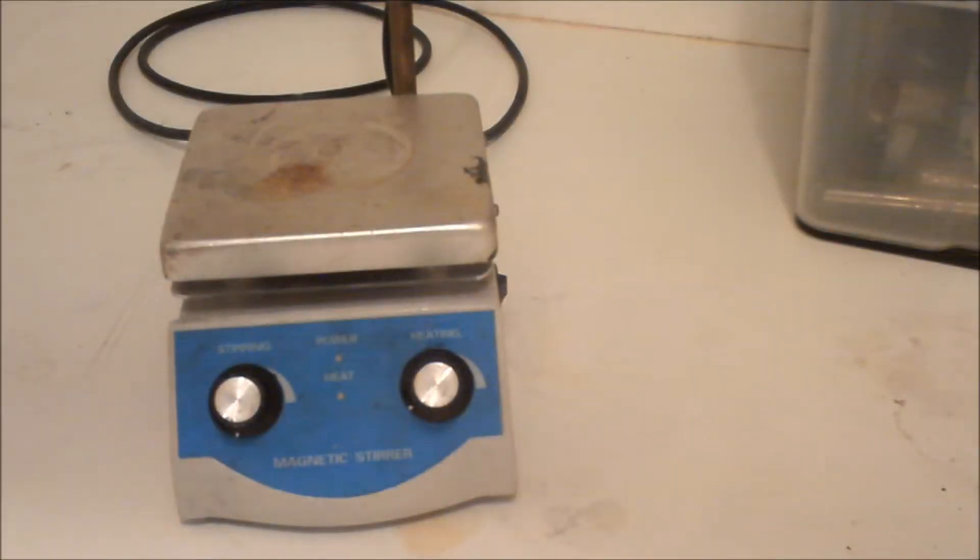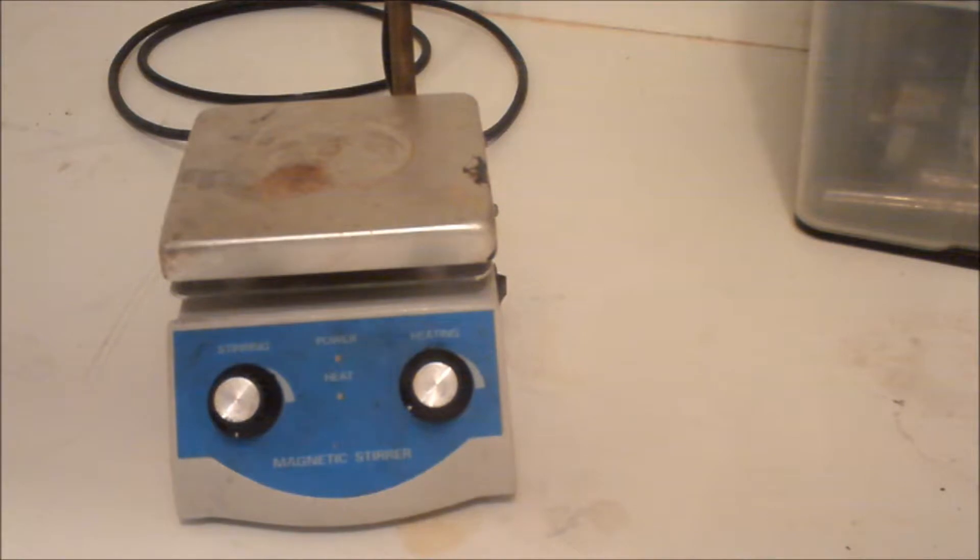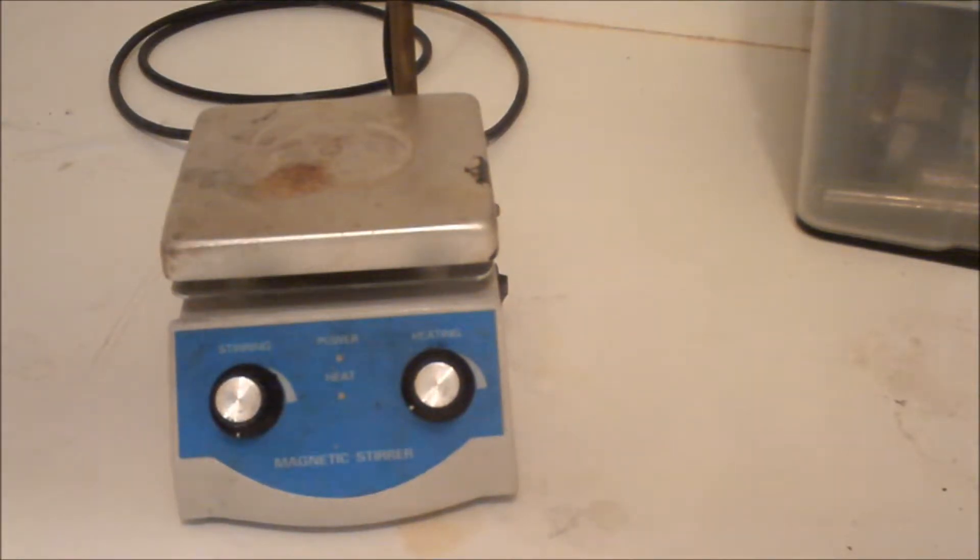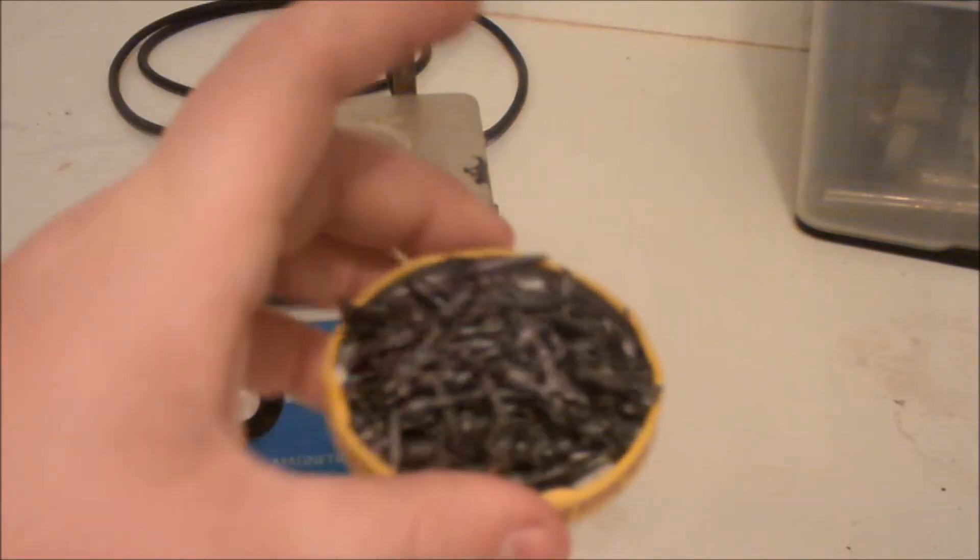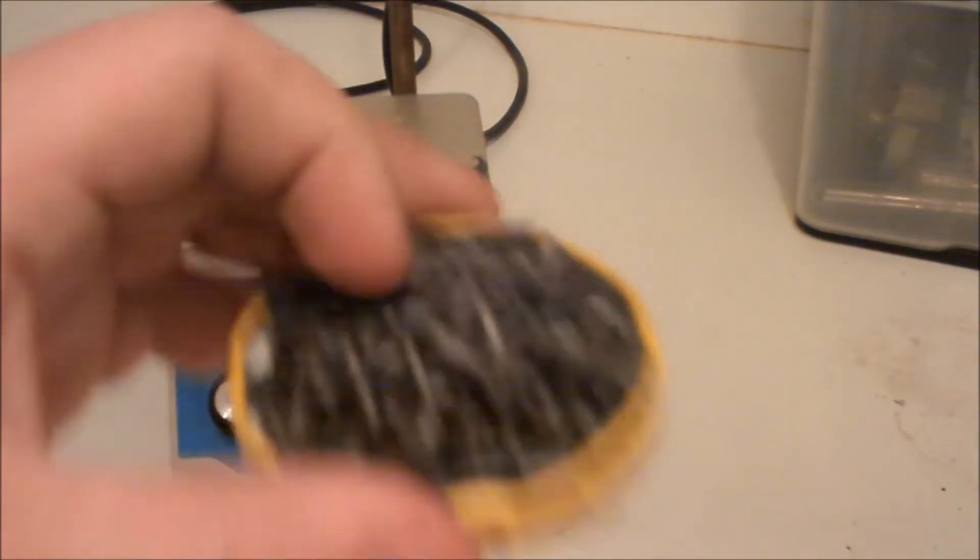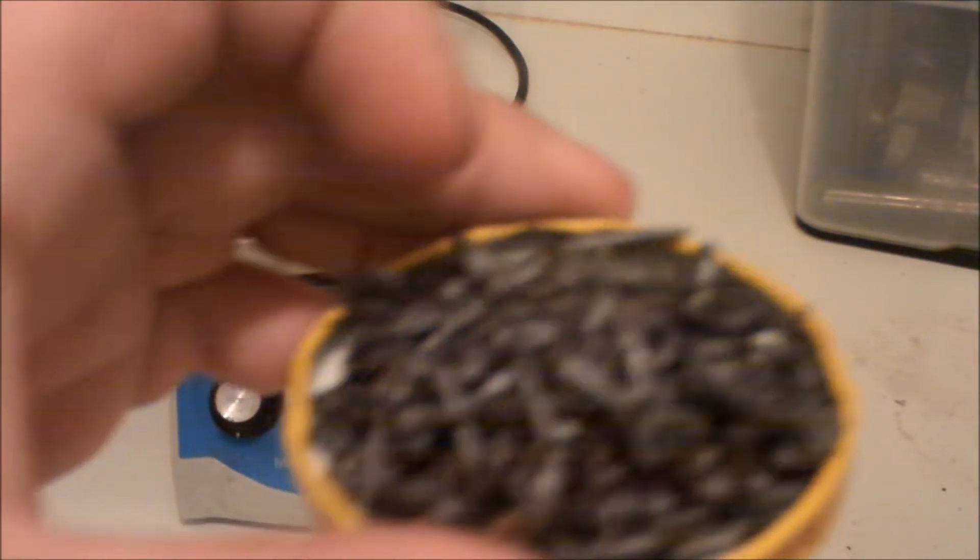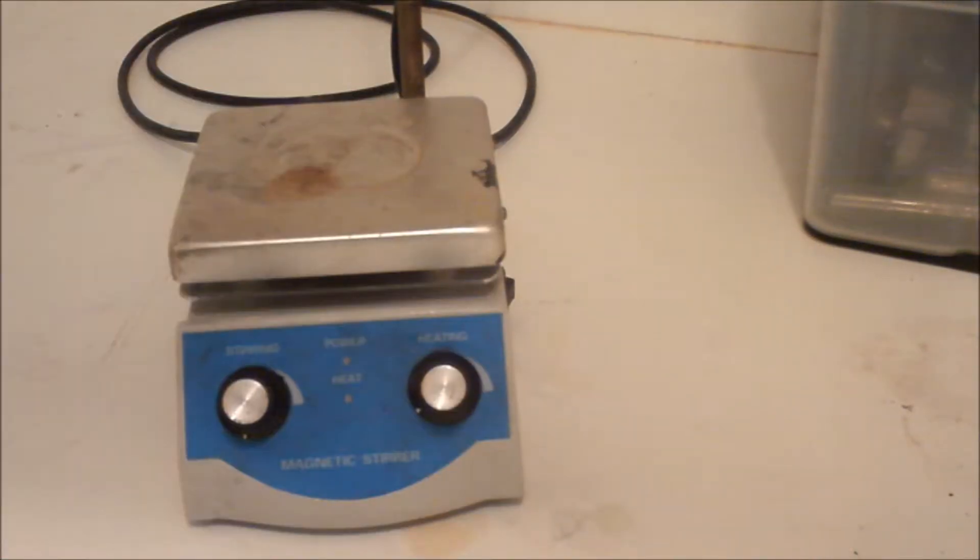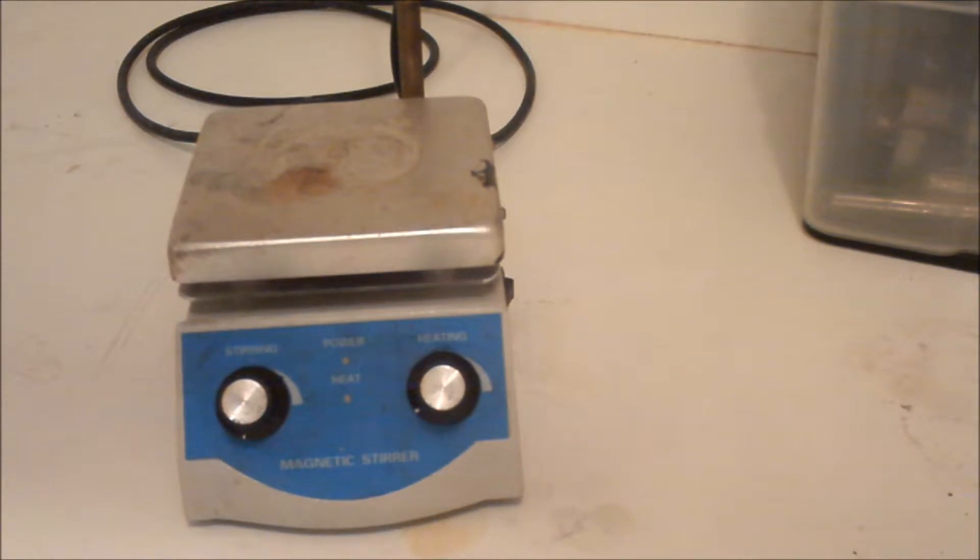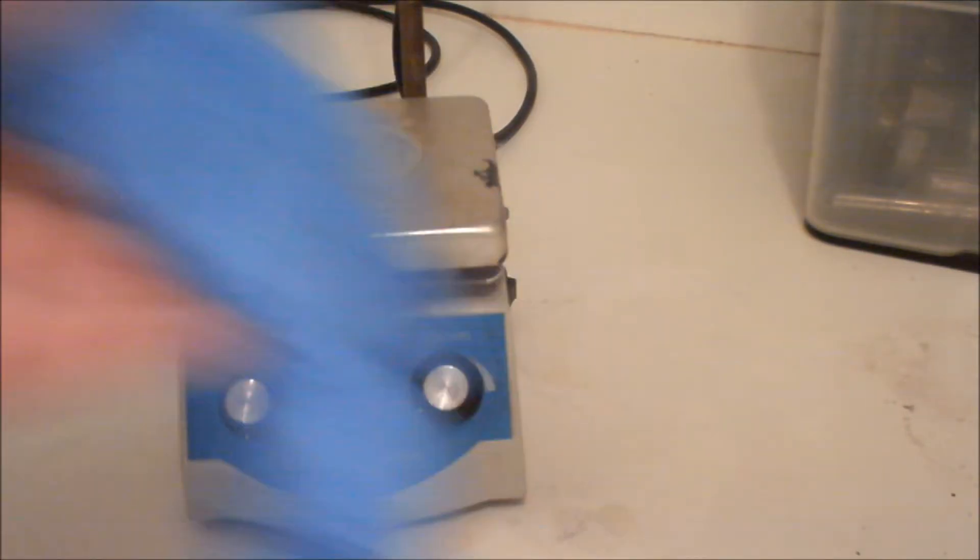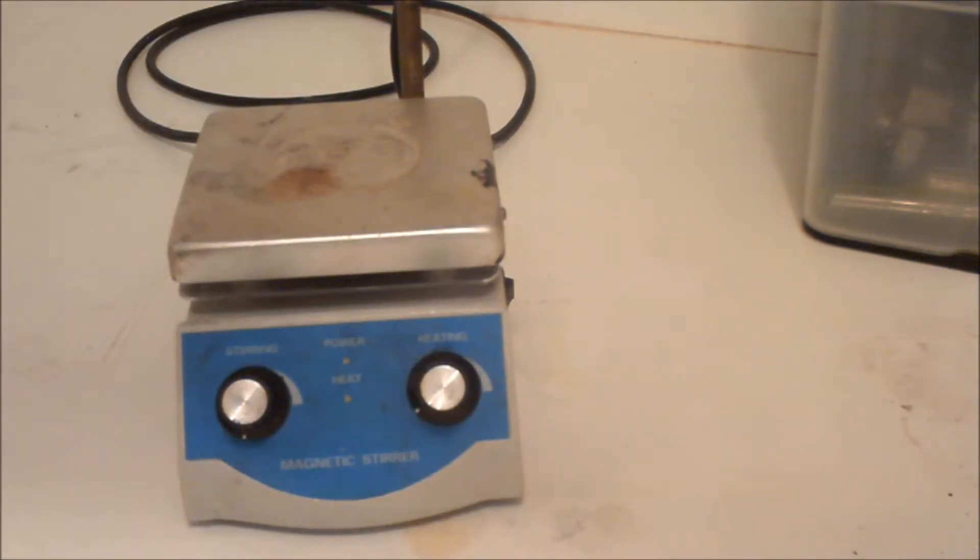Hi guys, today we're going to make lead nitrate. For this you're going to need nitric acid and some lead here - just little pellets, it was molten lead that was poured in water - a hot plate, and a beaker. You're going to need the proper safety materials, and I'm doing this in my fume hood.